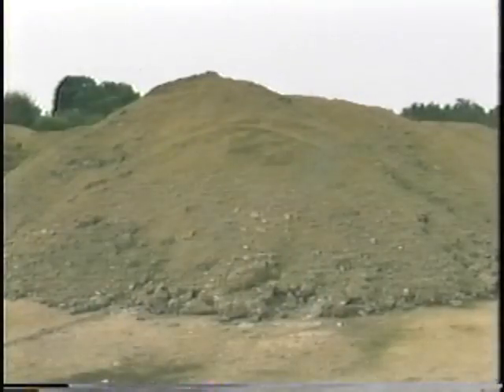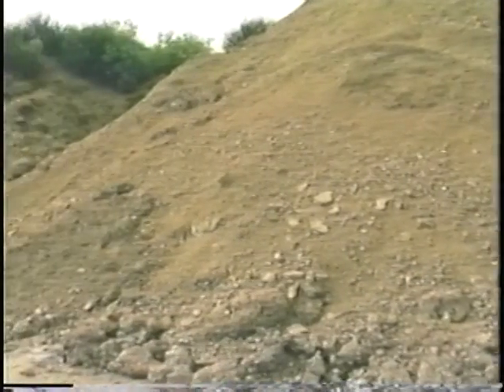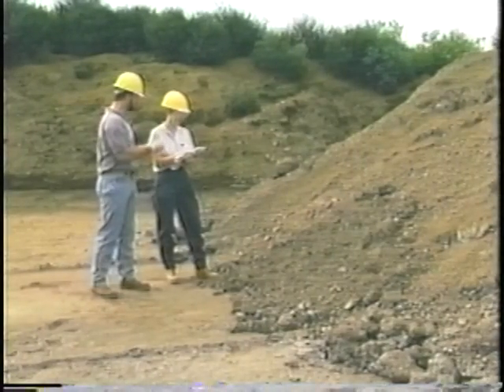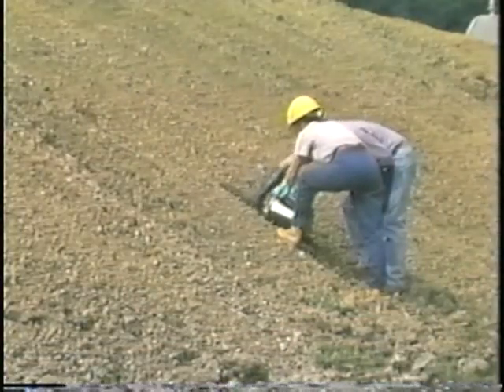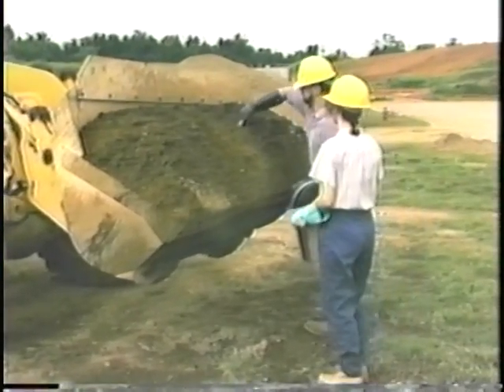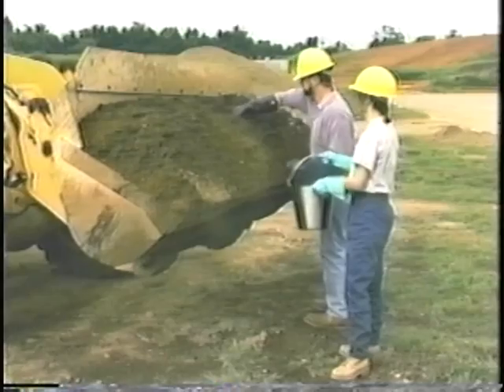A stockpile may be sampled using the same general procedures as the compost pile. It is usually more challenging to collect a representative sample from a stockpile because it usually is comprised of sludge that has been piled up over a longer period of time. Its shape is less uniform, so gauging how many sample aliquots to take from each section so that they are proportional to the mass of the section is difficult. The size of the pile can make it difficult to get aliquots from all depths. You can also sample the final sludge product on a front-end loader before the sludge is dumped into a truck that is going to haul it off-site.